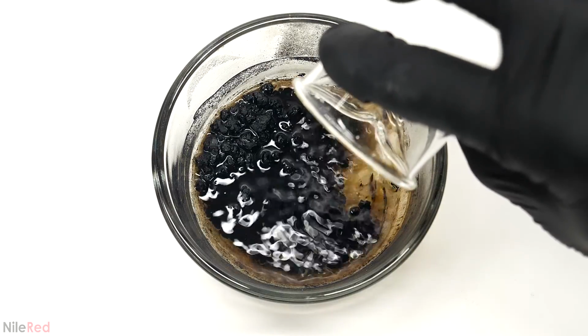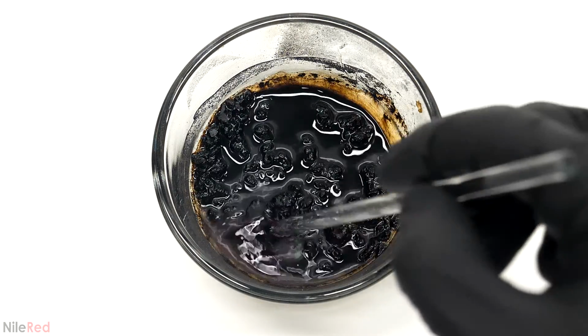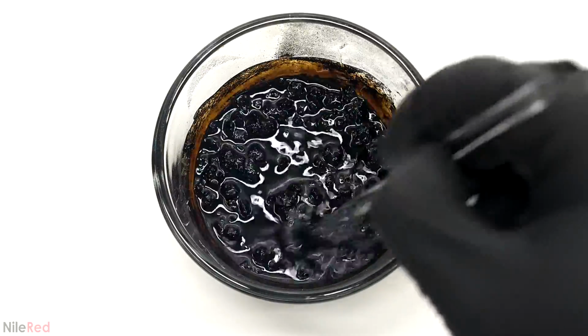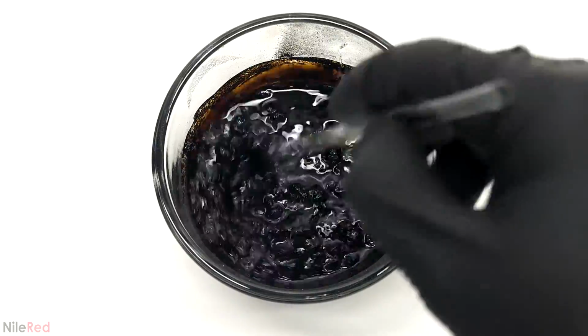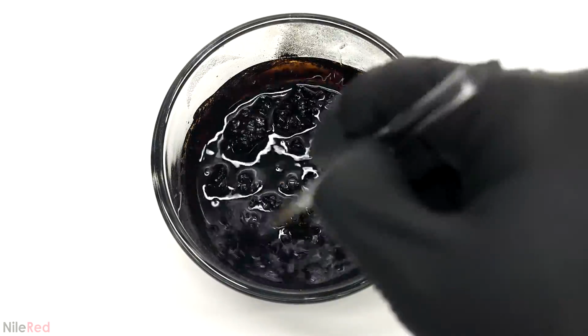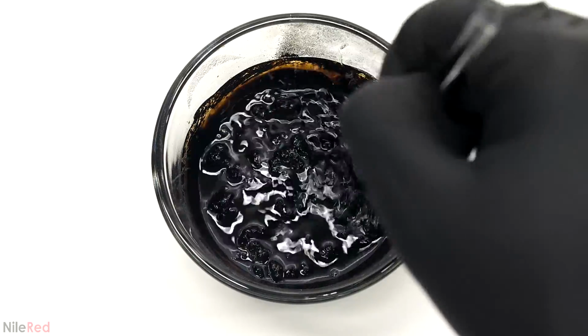The moment it was added, it all started dissolving, and the liquid quickly turned black. To be fully technical here though, the magnetite isn't truly dissolving, it's just going into suspension. This is because the nanoparticles aren't soluble in the solvent, but they're small enough that they can still easily get dispersed. The oleic acid coating then helps with this by preventing the particles from coming too close together and by also allowing them to interact with the nonpolar solvent.